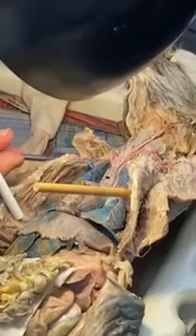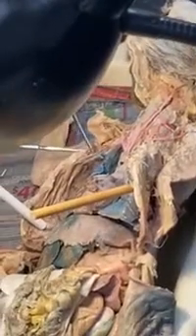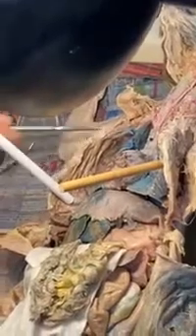Then axillary, out here. Here it is. This is axillary. VL, there's your ventral thoracic. Your long thoracic is a little bit out of position in this cat. And how do I know this is long thoracic then? Because it's going to this flap of skin over here. That's why that's long thoracic.